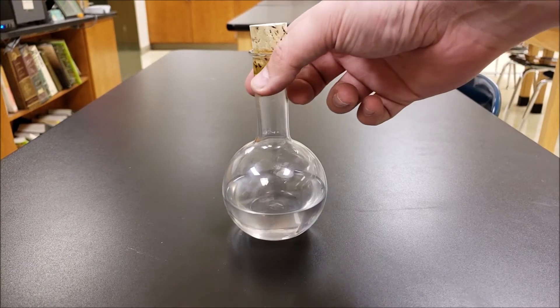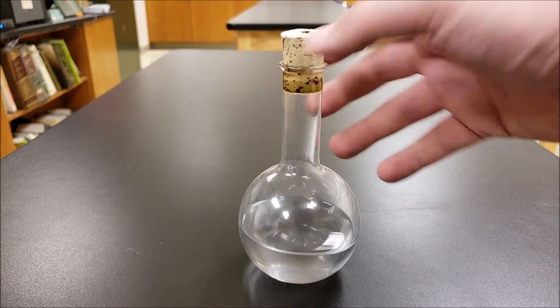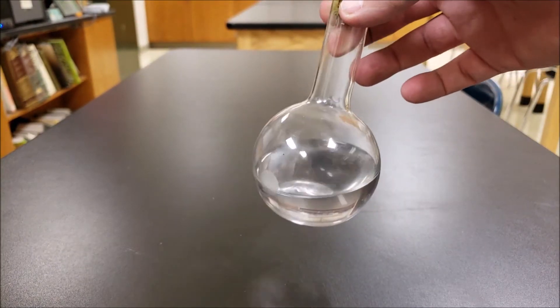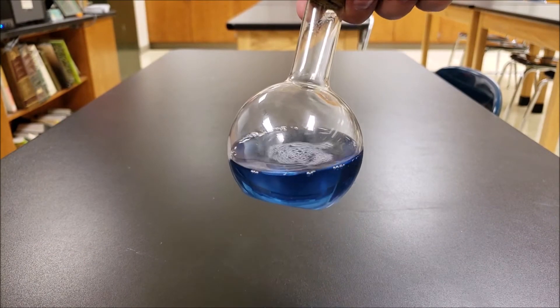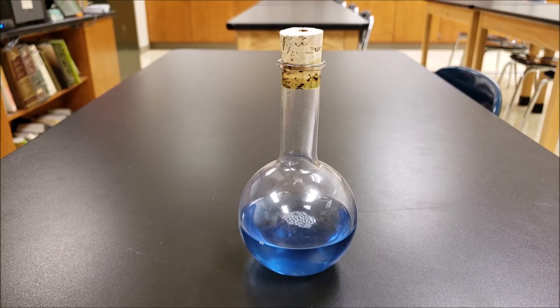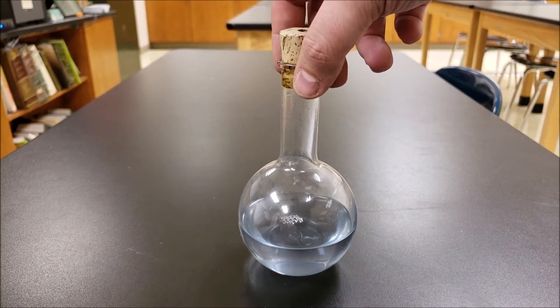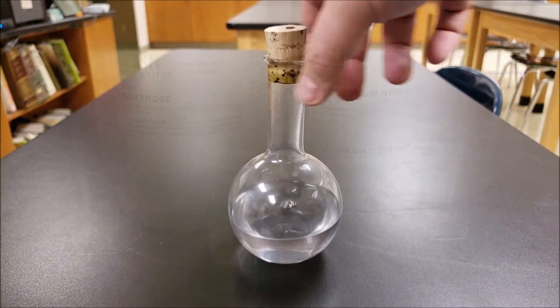We have a round bottom flask with a cork on it, so it's a closed system, and it's a transparent solution inside. Give it a little shake and it turns blue — pretty magical. What may be even more magical is that if you let it sit, it's no longer blue — pretty awesome.